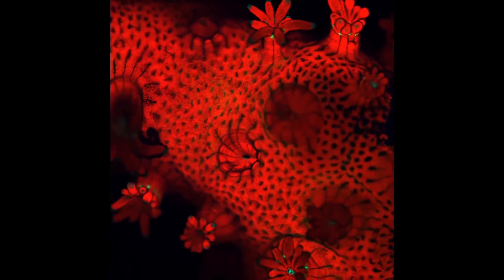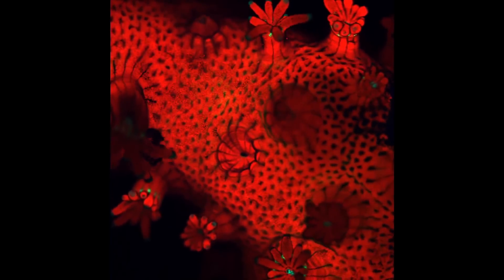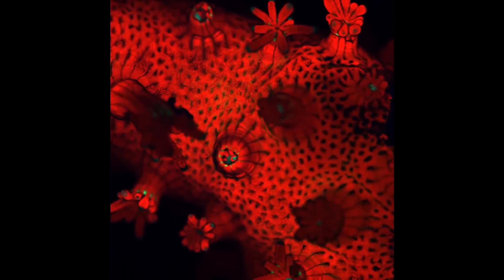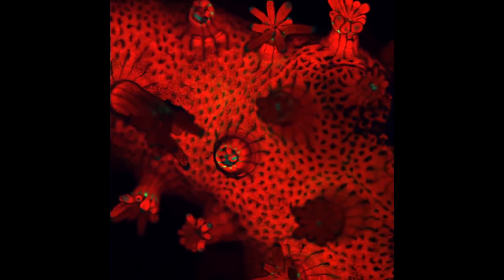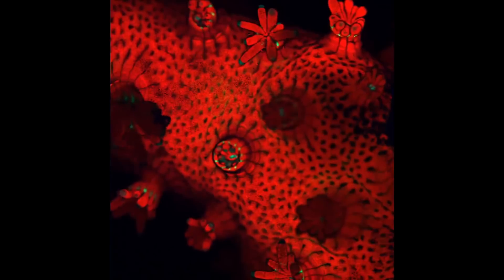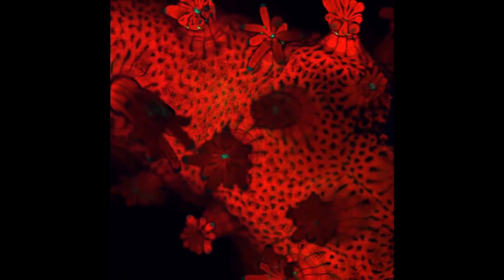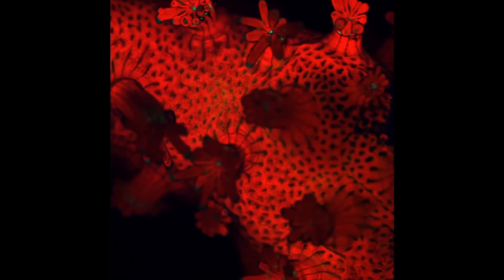Therefore, we can look at the coral and all associated organisms as a whole and living entity. Here, only the innate fluorescence of the coral itself and its associated organisms is imaged. No dyes or fluorescent labels are used. The bright red coloring of this healthy coral is due to the fluorescence of chlorophyll contained in the endosymbiotic algae known as symbiodinium.